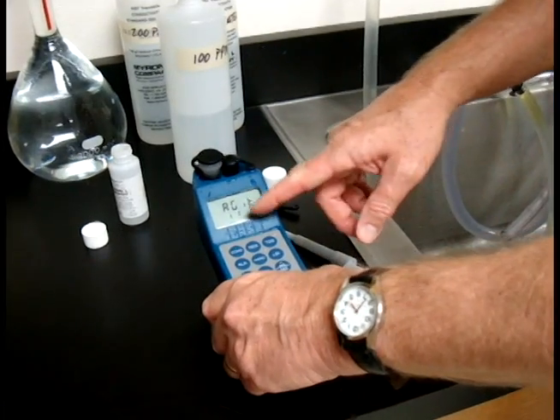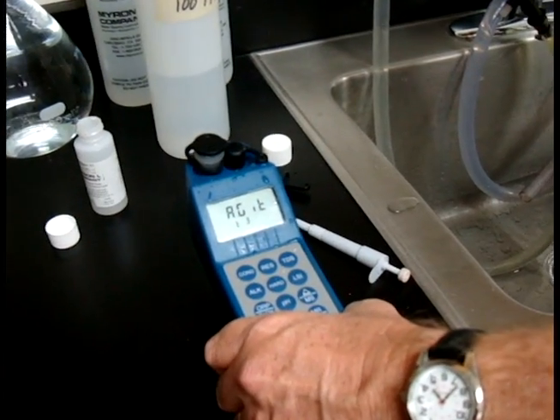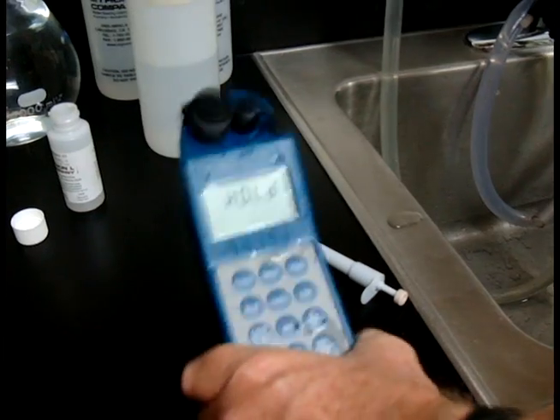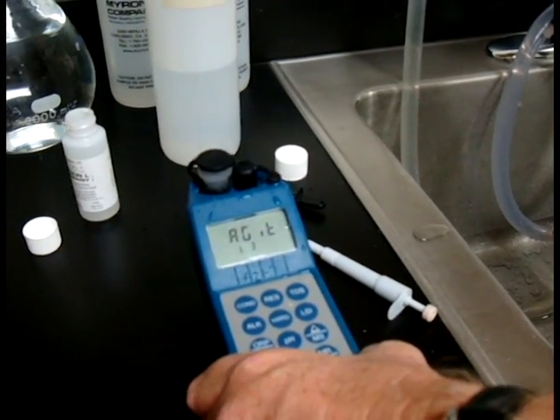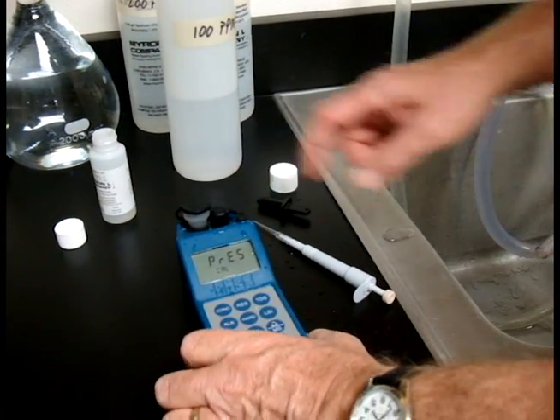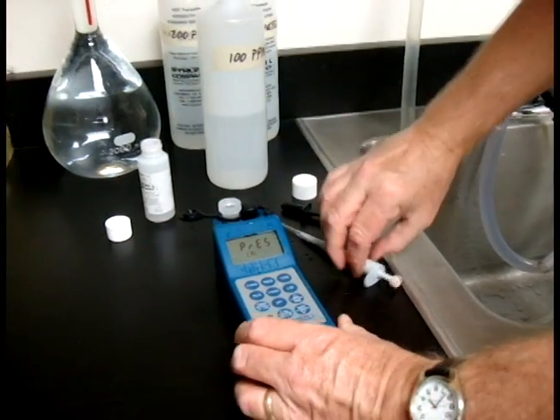See this number T3, that's the third titration I've done. And I'll tell you how many times you've titrated. See the T3 down here. Agitate. There it is. All right, take your cap off. Hit CAL.